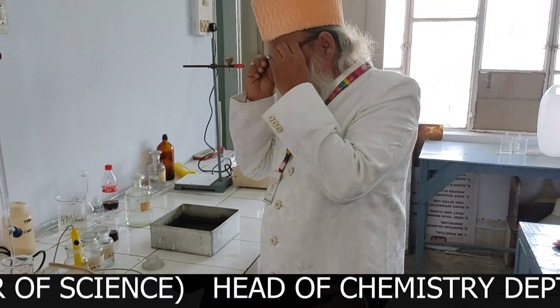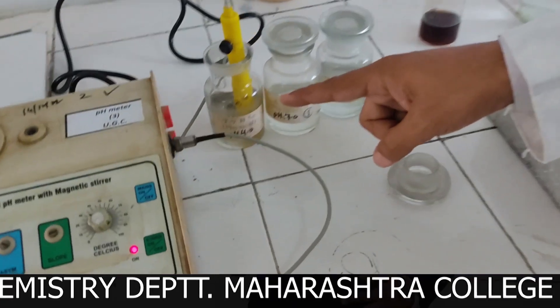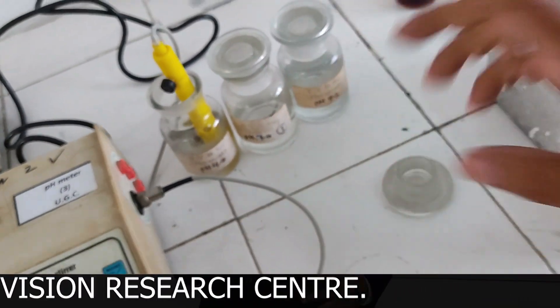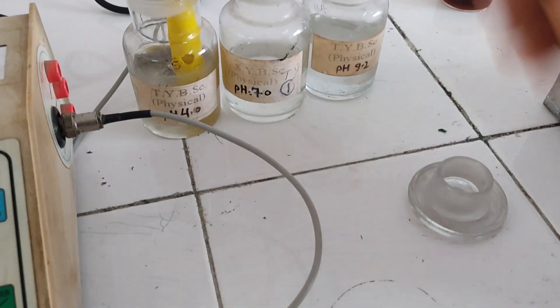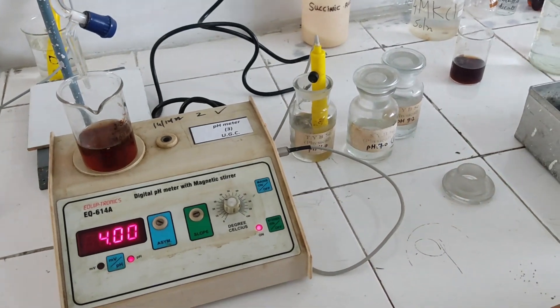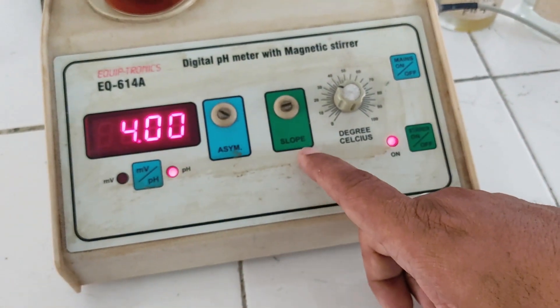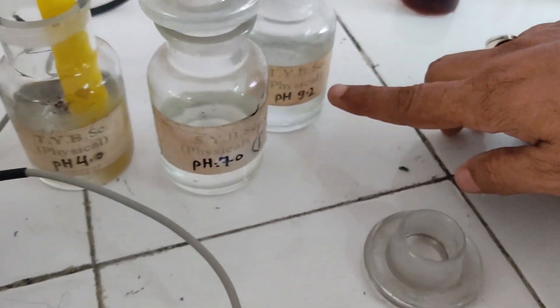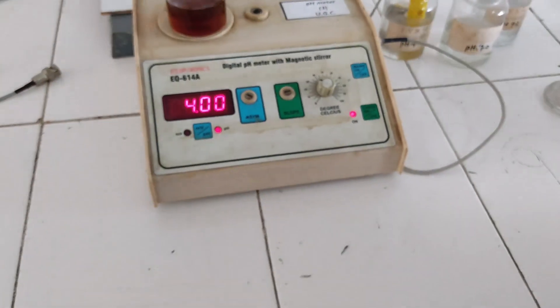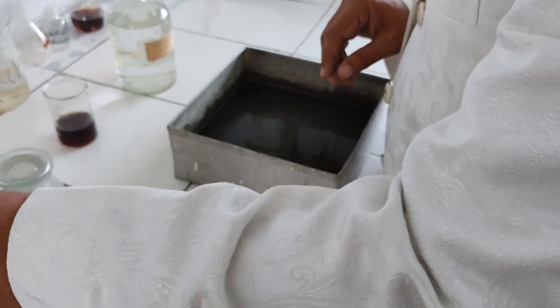Now here we have to standardize. We have standardized it with pH 7 by adjusting the asymmetry. Then we have standardized with pH 4 by adjusting the slope. Then we are going to standardize with pH 9.2 by adjusting the slope. After standardization is over, we take out the electrode, clean it thoroughly — the glass bulb has to be cleaned thoroughly — and then put it carefully into the solution.